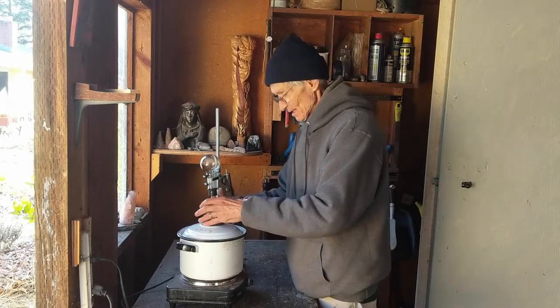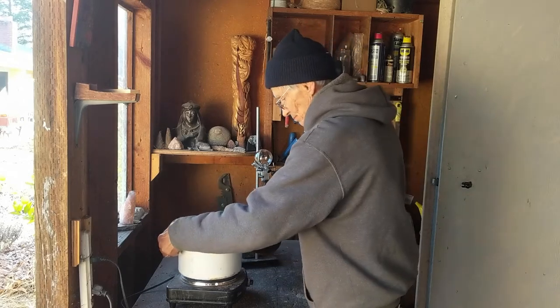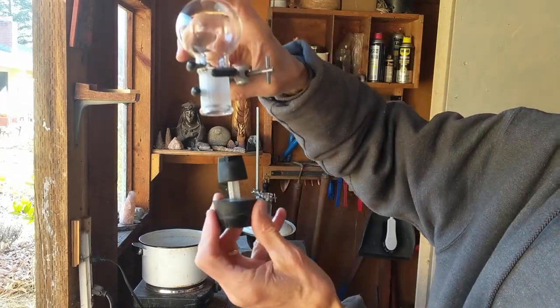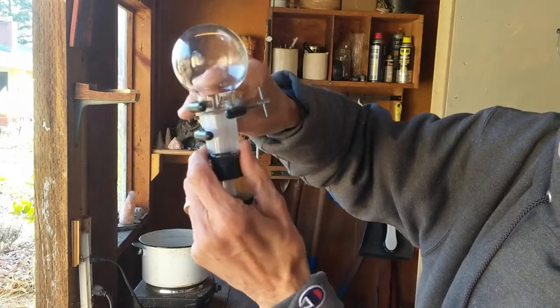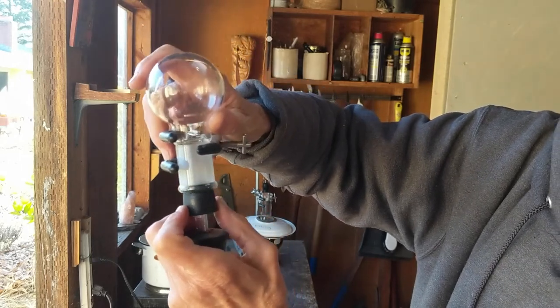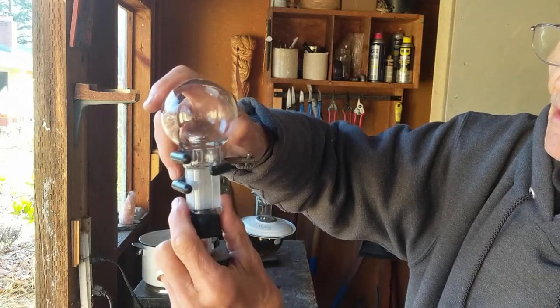The beauty part of the MB is that it's totally flexible. In here, hot water. Up here we have a little interesting thing that regulates. This little flask sits on top of the little stopper. This clamp is a little loose, and what this is designed to do is — if there's too much pressure from the alcohol that comes up, it just lifts the little flask up off the stopper and settles back down. That'll keep happening until the pressure inside and the heat regulate it.